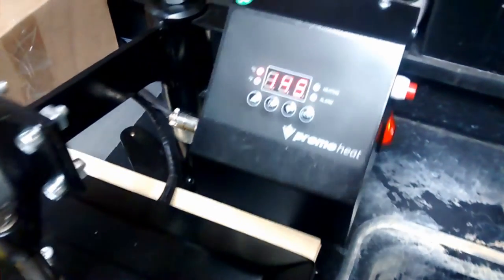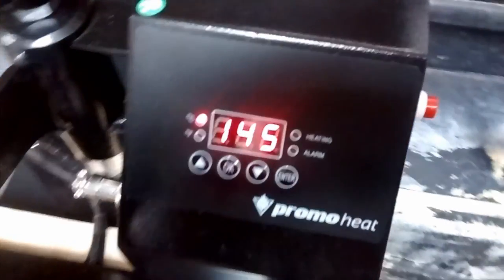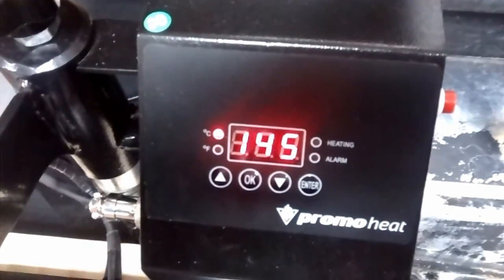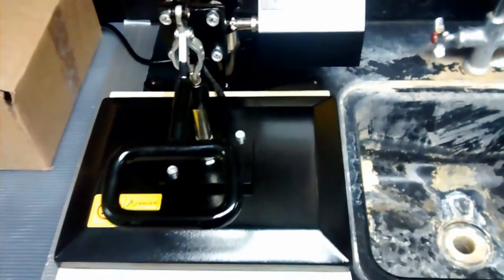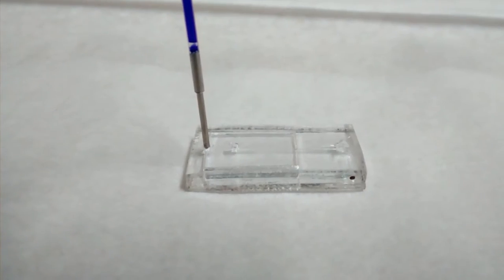The whole thing gets sandwiched in this heated press along with a piece of plastic to cover the channels and that seals the whole thing into one unified device that looks like this.